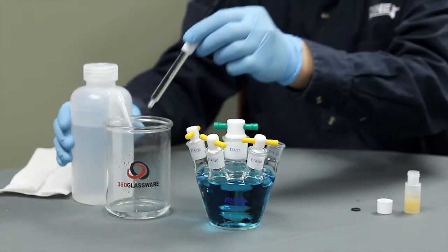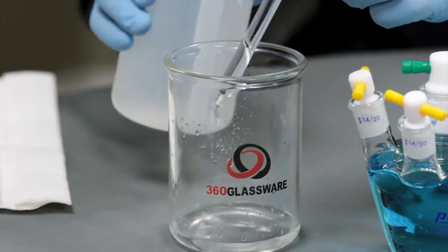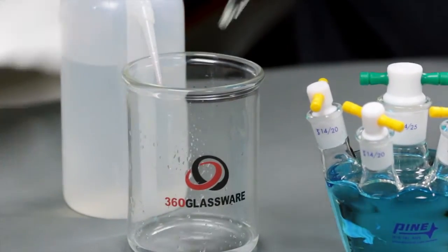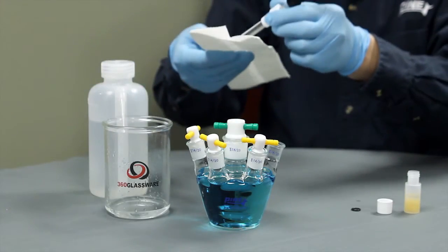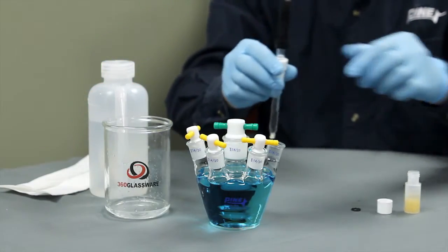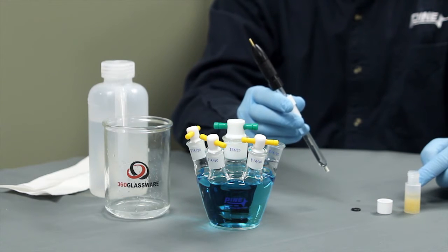Once you've completed your experiments, make sure to rinse off the electrode before storing it. You should always store it in the storage bottle that came in the package, making sure to keep the tip wetted by soaking it in the filling solution.